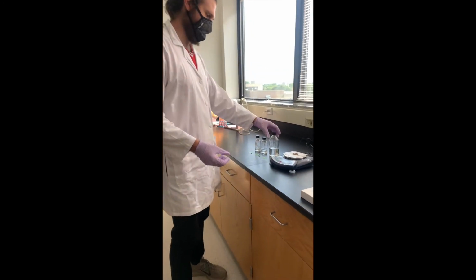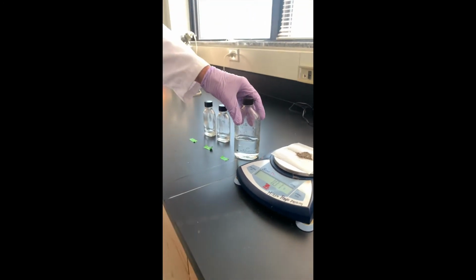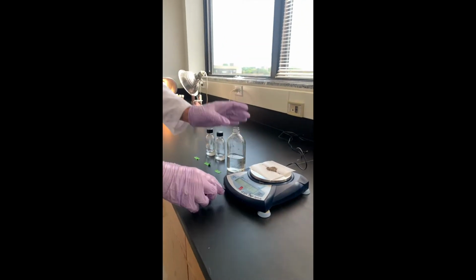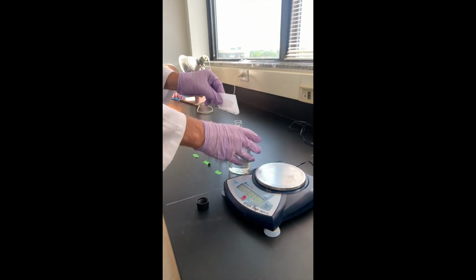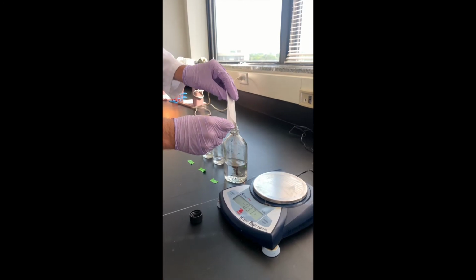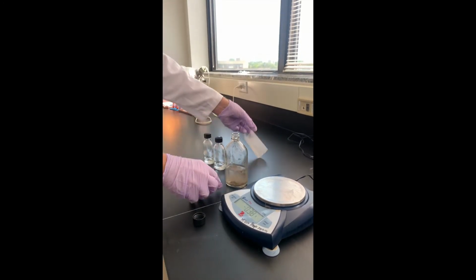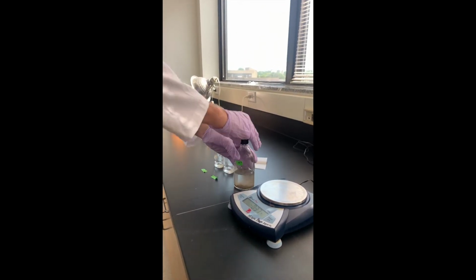So we'll start with a gram of soil, and we're going to put it into some water that's 99 milliliters of water. And by doing so, we're going to be diluting this by 100 times. So this is going to be a 100x dilution or a 10 to the negative 2 dilution. Soil in there, put the label on.